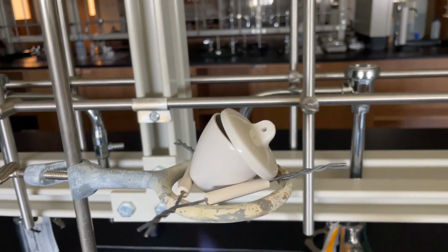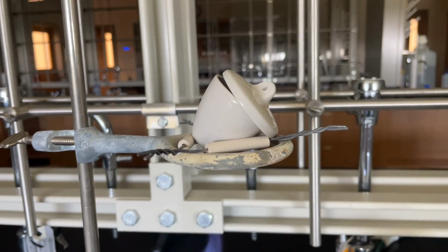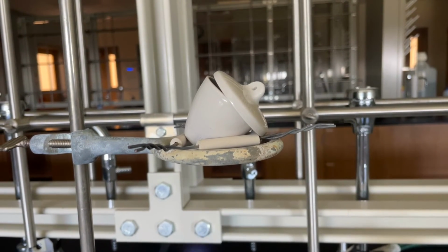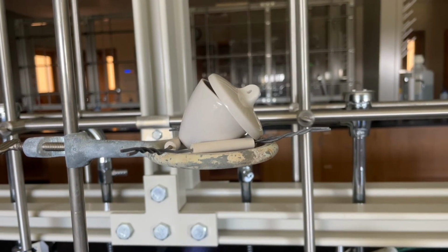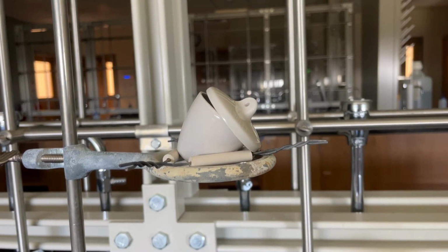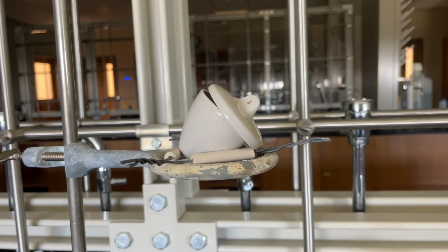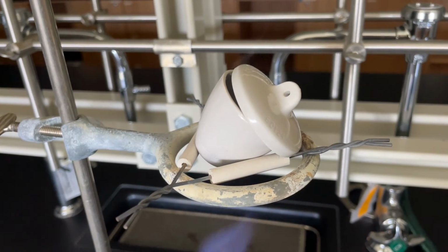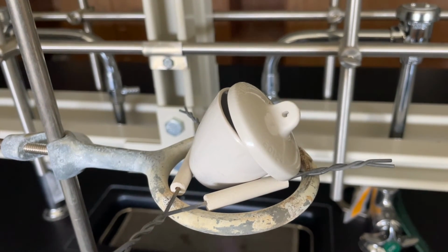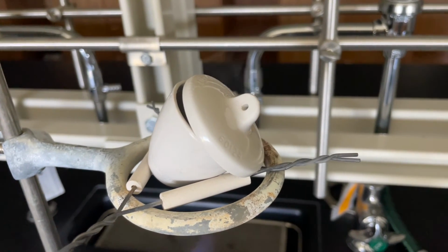We need to repeat the heating and cooling process here just to ensure that we don't have a hydrous salt inside of our crucible still. So we're going to heat it very vigorously. What happens is that salt starts to crystallize anywhere that there was water or aqueous solution, and so there is a tendency to get some water trapped in between the crucible walls and the crystals that form over it. And so heating it a second time here, we may see a little bit of steam, or hear a little bit of popping as any of that residual liquid water becomes gaseous and escapes through the salt crystals. And so on occasion here you may see a little bit of water vapor when that happens.